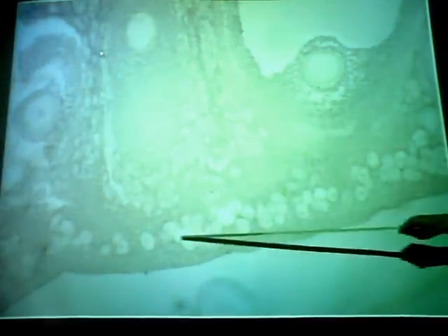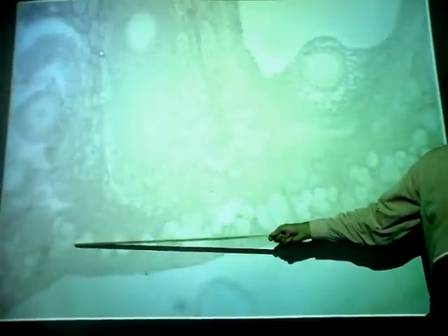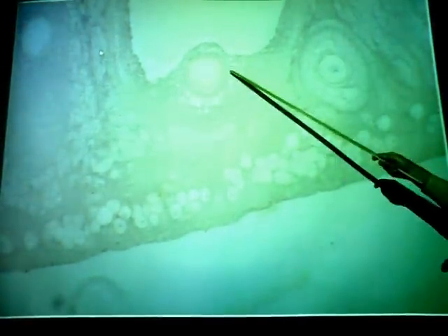Here are the follicles, the small, very numerous ones, more to the outside. What kind of follicles? Primordial. These are the most immature. What appears to be a nucleus inside these is actually a developing egg cell, in a very primitive state. Here we have a primary starting to go to secondary. Here we have a secondary follicle. Again, this is the egg cell and nucleus. Here again is the egg cell. Here are the cells around it, the corona radiata, and there's that fluid filled cavity, the antrum.